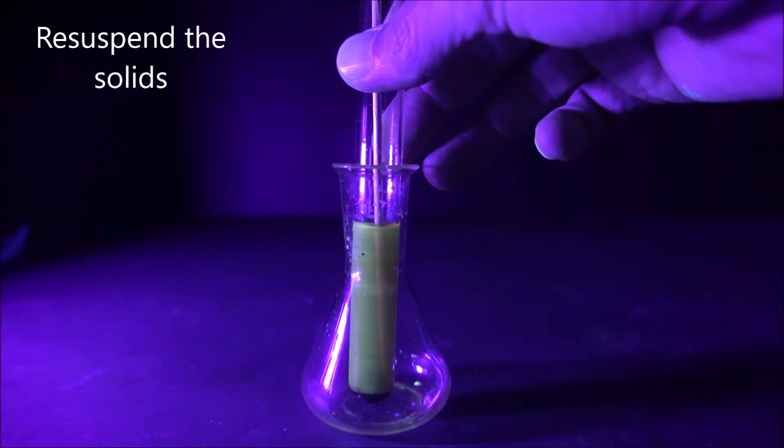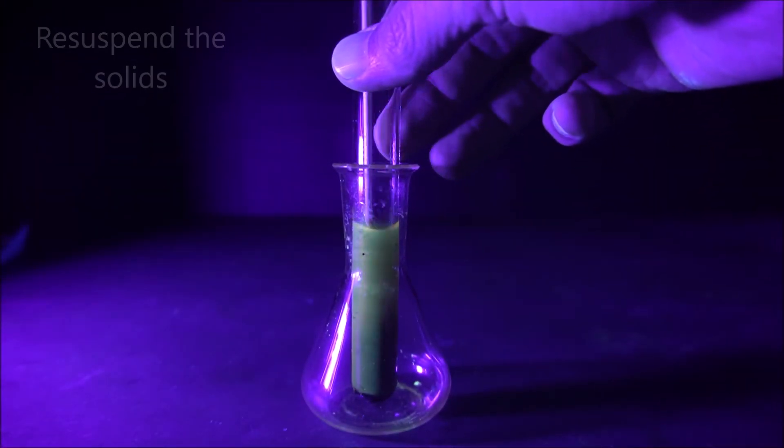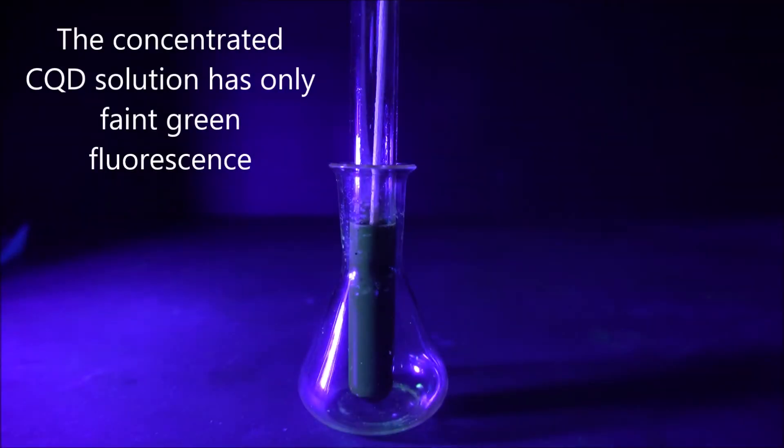We suspend the carbon quantum dots with help of a spatula or skewer by scraping off the solid that is stuck to the bottom of the tube.